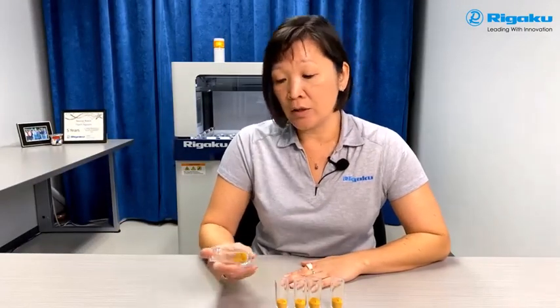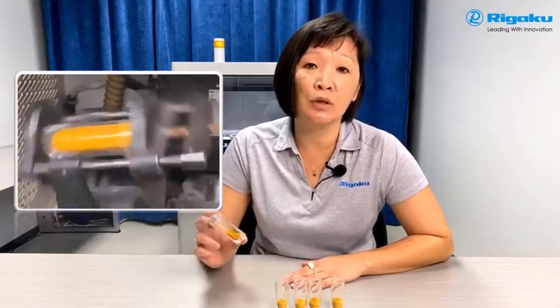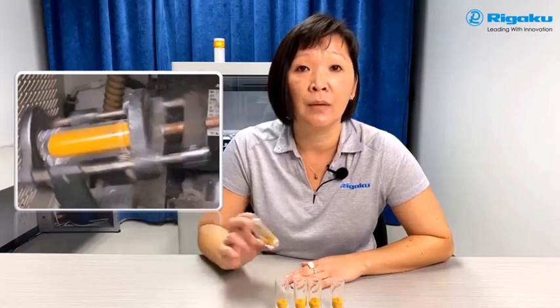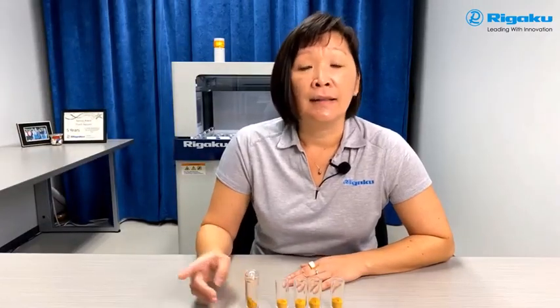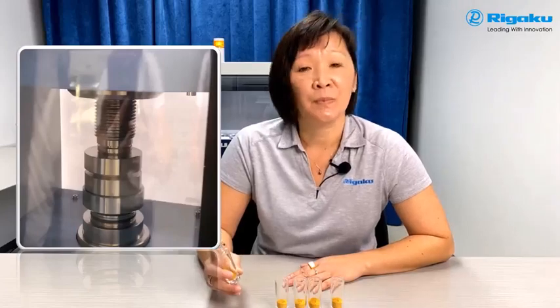The next thing that you want to do is put it into a mixer mill. On this video, you're seeing that it's in slow motion because we want to show you that it's very important that you homogenize your sample before you press it into a pellet. And then the next step is to press the pellet, and we're showing you here the pancake press method that we did previously. All right, we have another video on that, they can check it out, right? Exactly. Make sure you go on the T&G show and look at it.